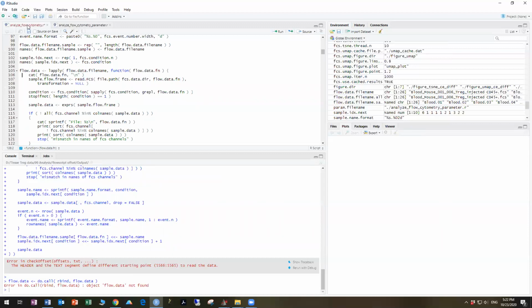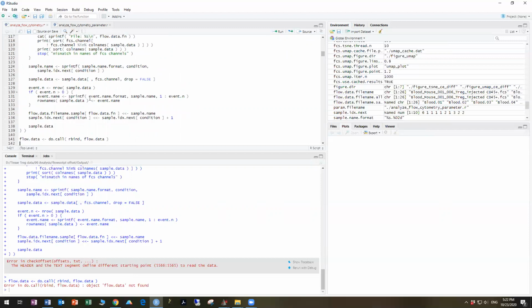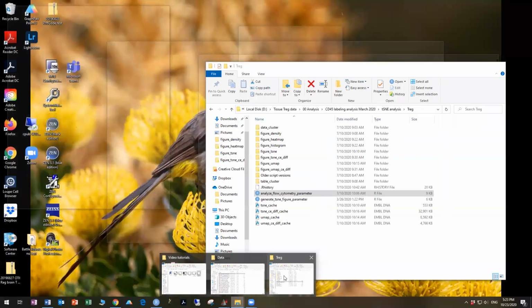So when you do that, you modify the script and it becomes red. So I typically do not save it at this point because I don't actually want this change to be permanent. So we're going to select the data, select the commands here, and run it again with that command active. And now you see that as it goes through and tries to load in each individual file, it lists them for us so that we can see which one it got to before it ran into a problem. And so that last one in the list here is the one that contains the offset error, or at least one of the ones.